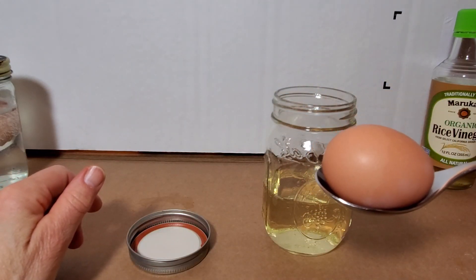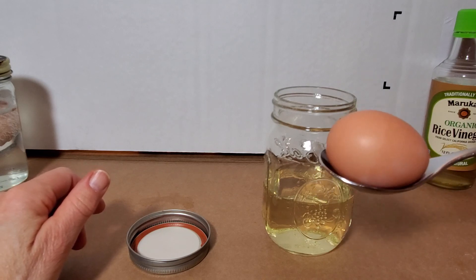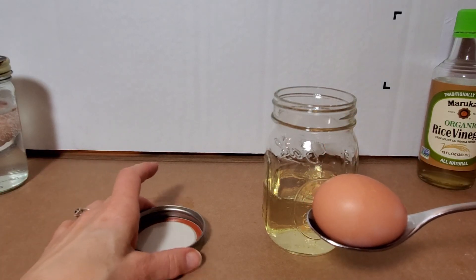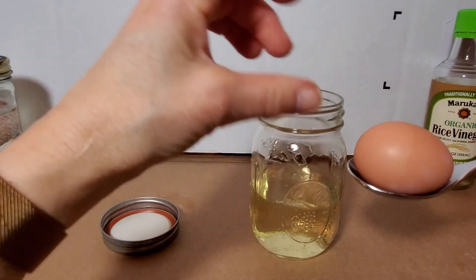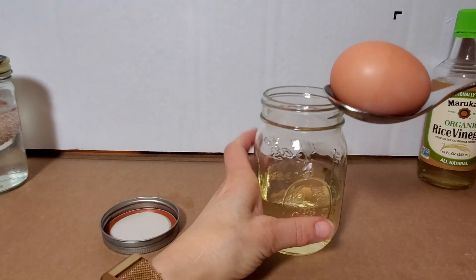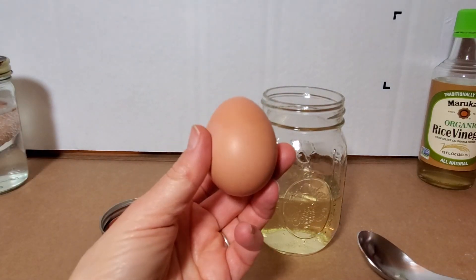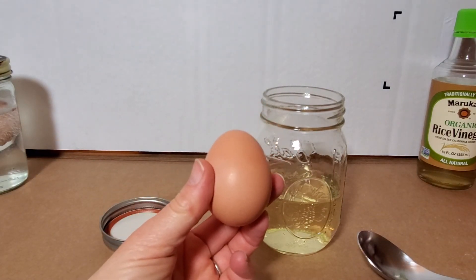I'm using a spoon to transfer the egg into the jar because the egg will just drop to the bottom and crack. I do not want the shell to crack at this point, so I'm just going to, before I slip it in, I started to talk for a moment about why this is such a good model for a cell.